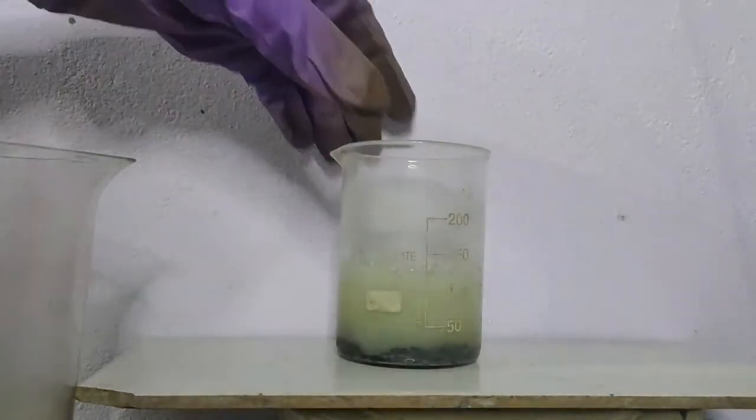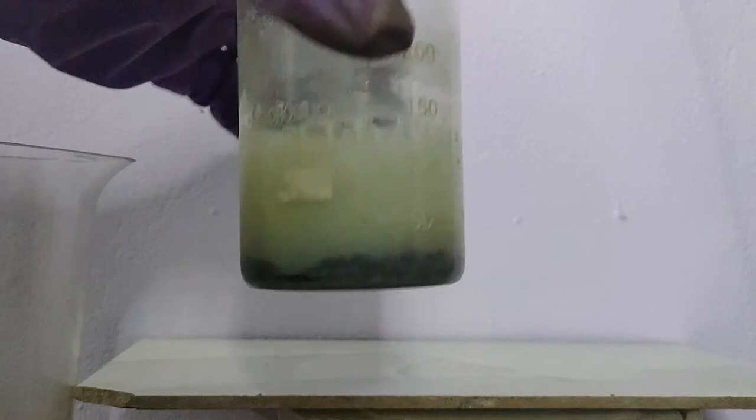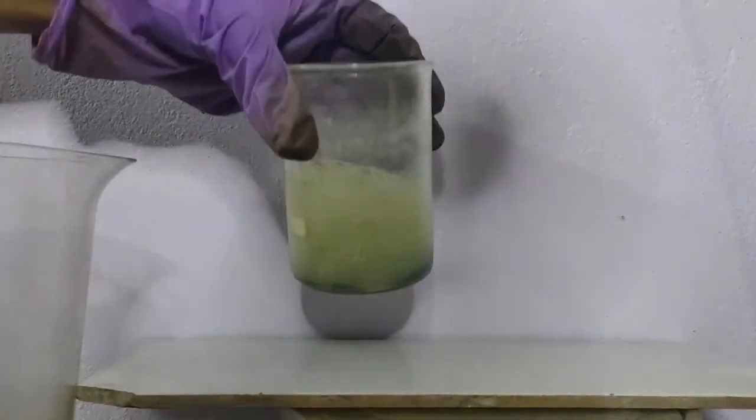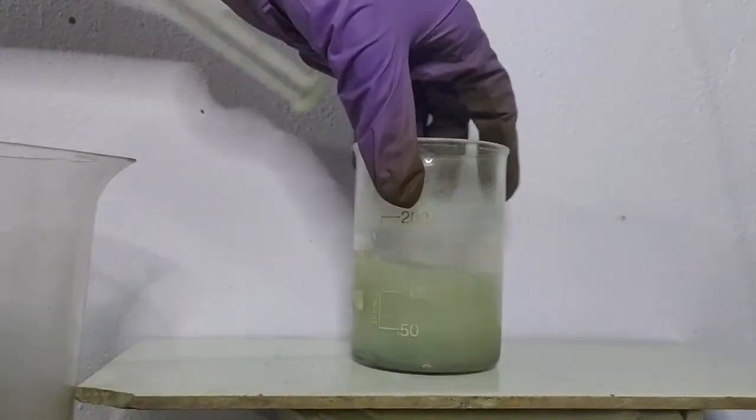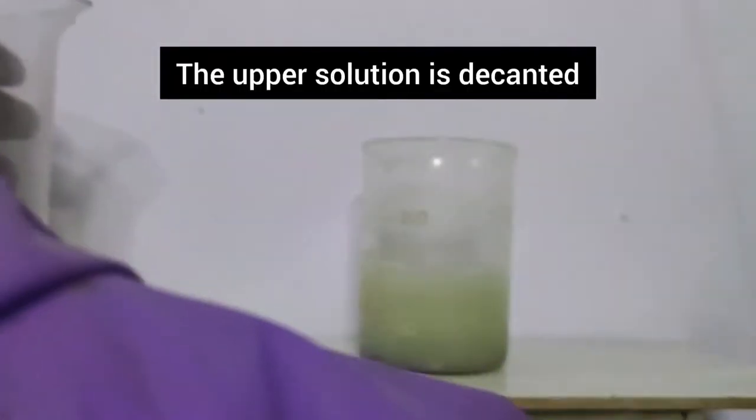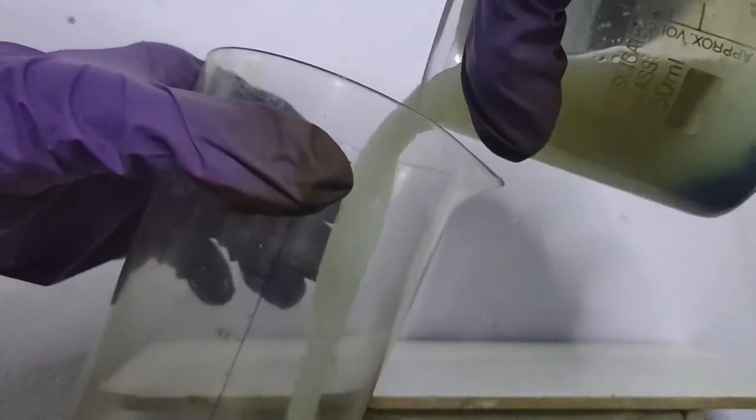Now, after a few runs, a lot of metal powder is extracted. I tested it. It contained lead as well as tin. So, now we have to purify this.